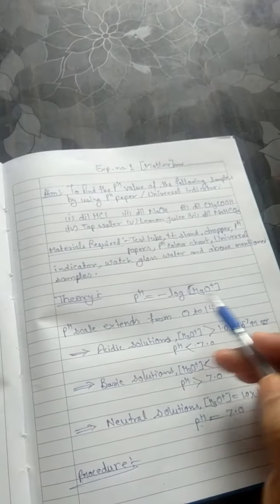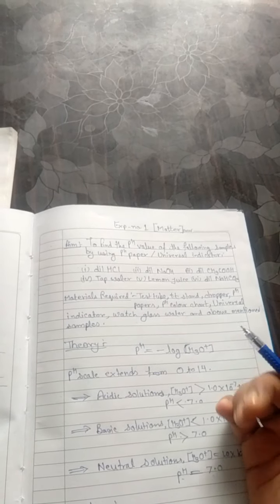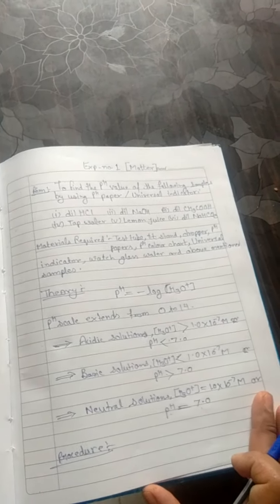So students, you have seen how to test the pH of different samples in our lab. It is a very simple procedure, and the theory belonging to this experiment is very interesting. Similarly, you can check various samples of your household things, such as milk, other juices, fruit and vegetable juices, by using universal indicator and pH paper. Not only this, you may test your body fluids also. What is the pH of your body fluids, such as sweat, blood, saliva, urine, etc. So pH indicates the acidic and basic character of samples. Thank you.